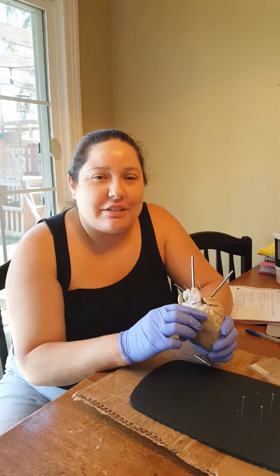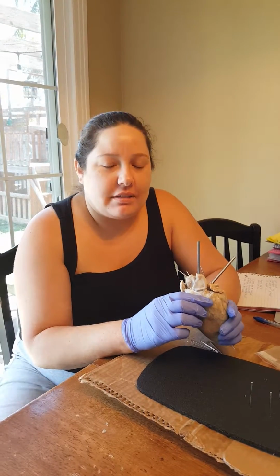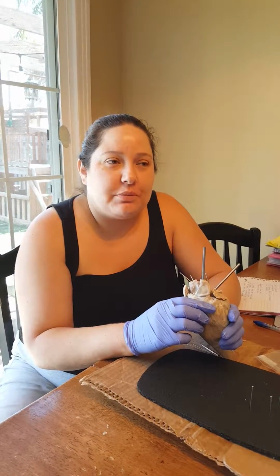Hi, my name is Melissa Herzog, and we are doing the dissection of the sheep's heart.